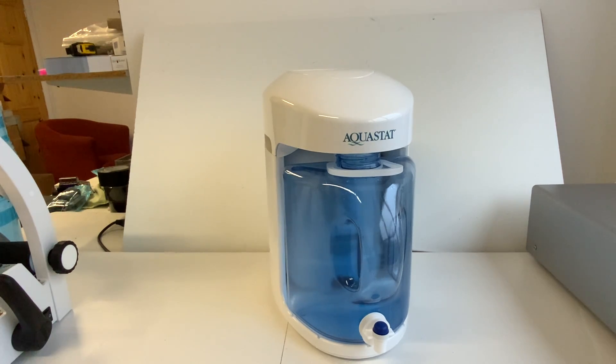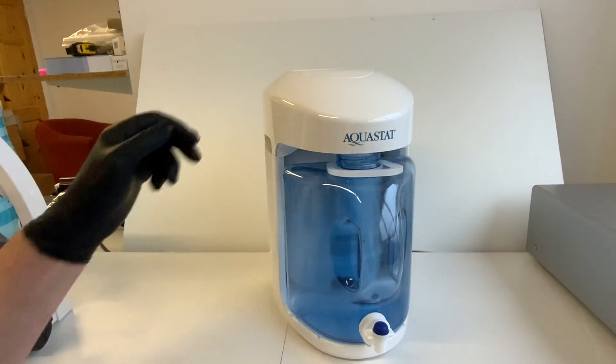To use the autoclave you will need distilled water. This is the Aquastat, a very reliable system, and in here there are three components.